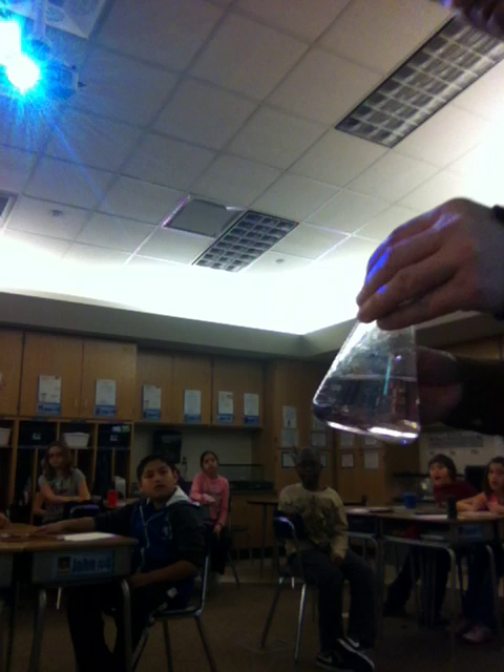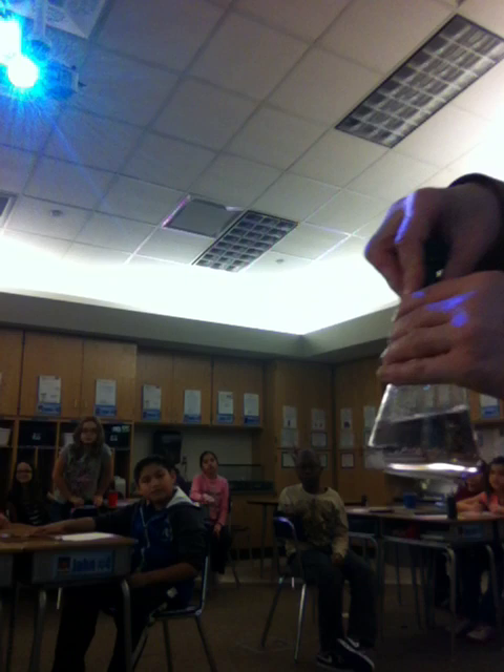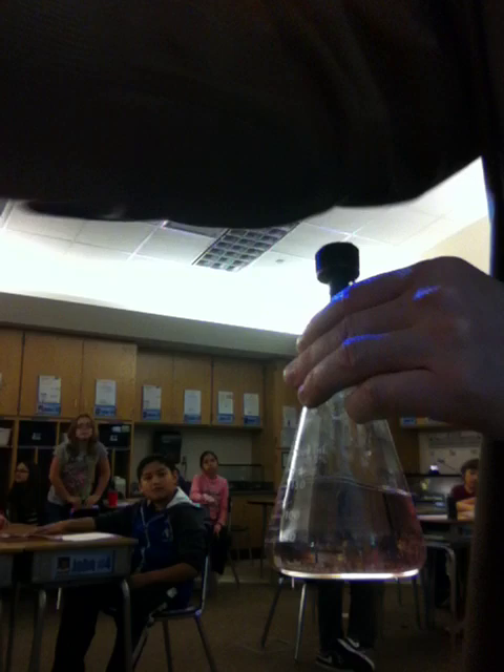In order to trap the gas inside the flask of hydrochloric acid, I'm going to fasten this to the neck of the flask. Here's our 250 milliliter flask — it's got hydrochloric acid in it. I'm going to put the stopper over the neck of it.